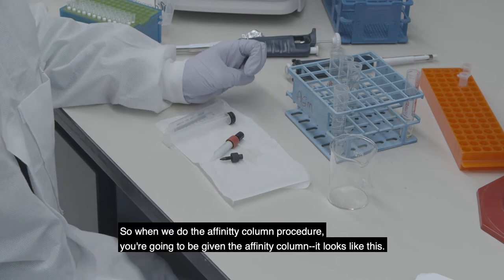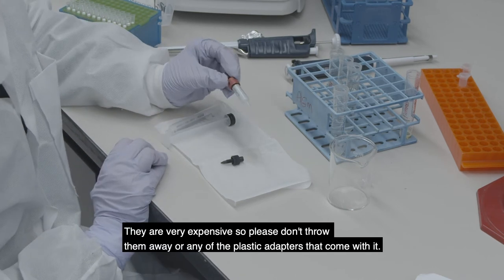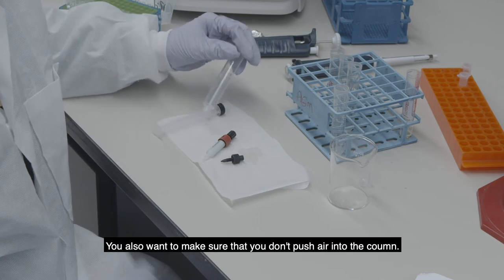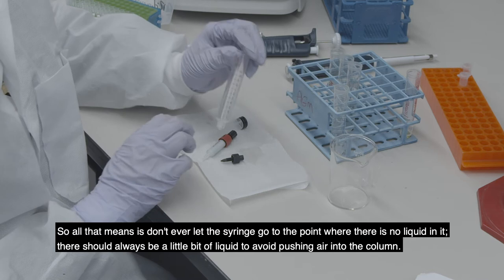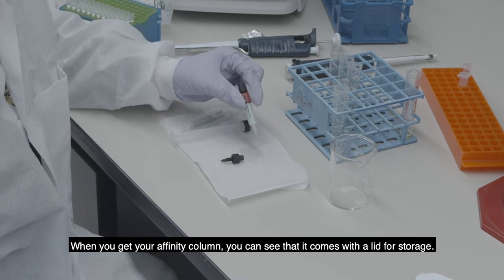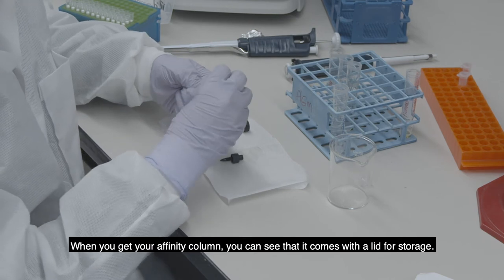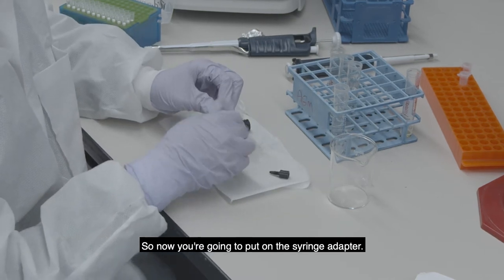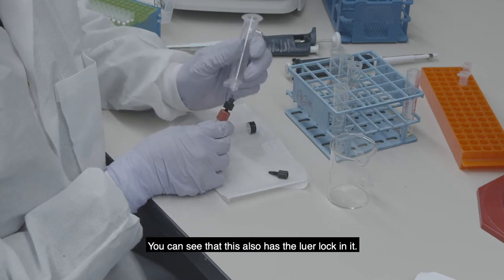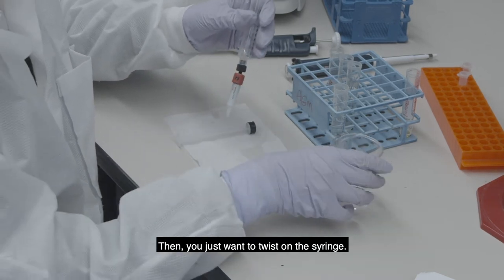When we do the affinity column procedure, you'll be given the affinity column — they are very expensive, so please don't throw them away or any of the plastic adapters that come with it. Also make sure you don't push air into the column, which means don't ever let the syringe reach the point where there's no liquid — always leave a little liquid to avoid pushing air in. When you get your affinity column, you can see it comes with a lid for storage. Now put on the syringe adapter, which also has the luer lock, and twist the syringe on.